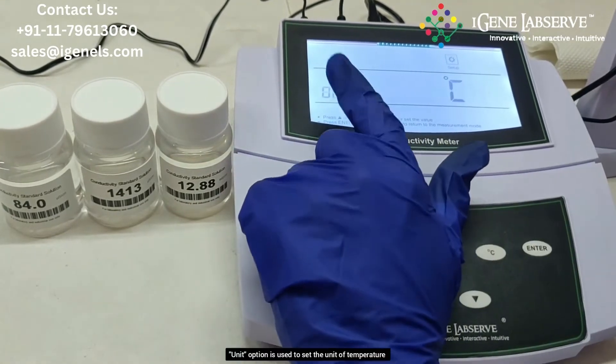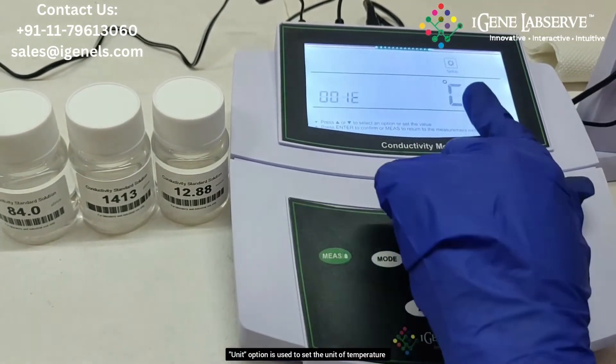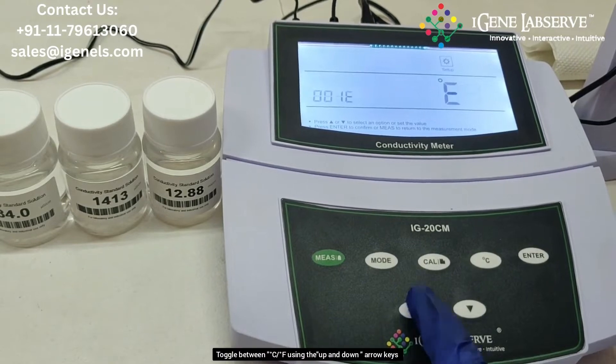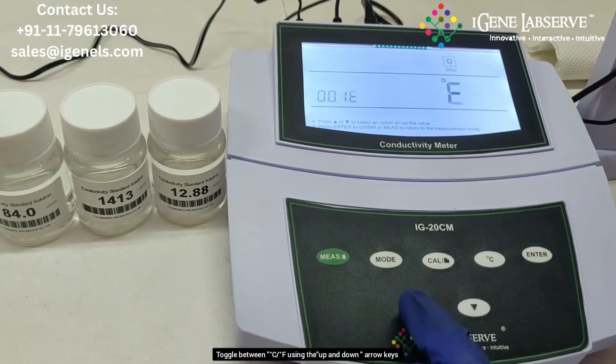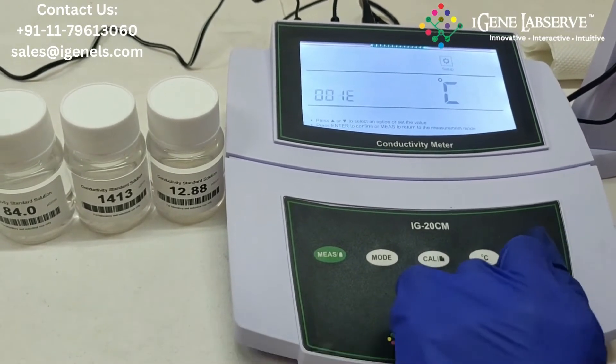It goes to the unit for temperature. You can select between degree Celsius and degree Fahrenheit, then press enter.